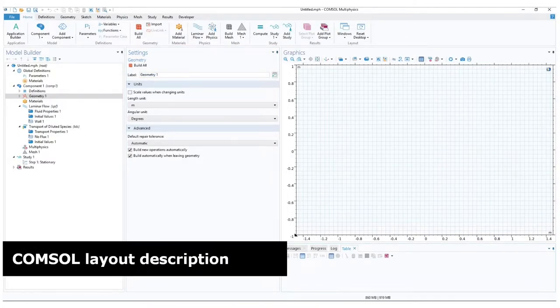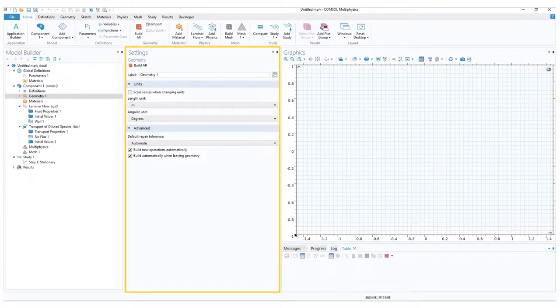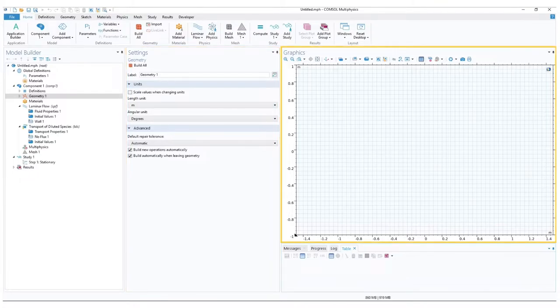Here we have the basic layout of the simulation area. On the left side ribbon, we have the model builder, which gives us access to parameters, geometry, physics, mesh, studies, or simulation time base and results. In the middle section, you have the detailed settings window. Its content will change depending on which option you select under the model builder. On the right side, we have the drawing, simulation, and graph results area. Below it, we have the messages, progress, log, and table. In the top, we have a toolbar with better access to options from the model builder ribbon.